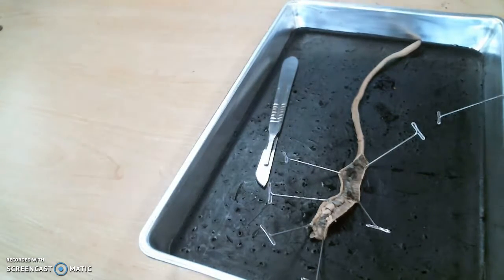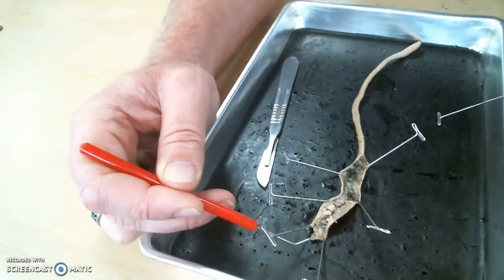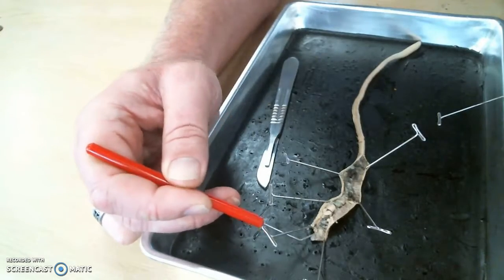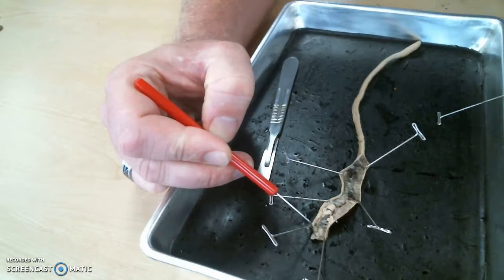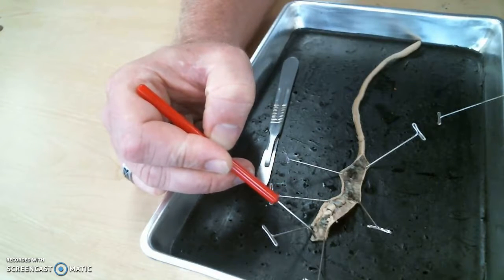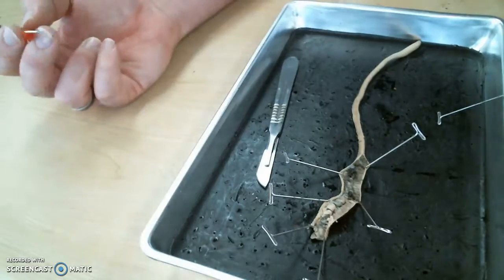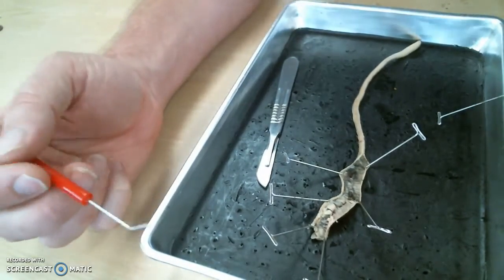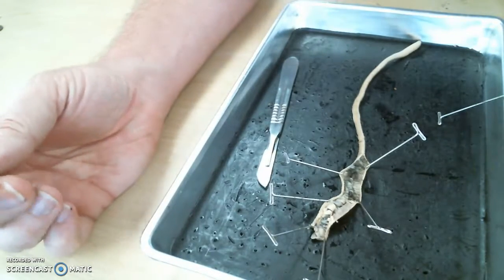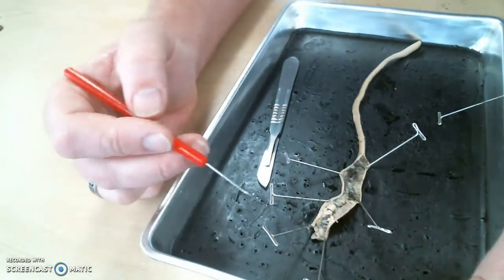That'll work. Okay. So, we already said the mouth was up here. And there's this beige organ right inside the mouth, and its job is to suck soil through the mouth. And what's that sucking organ called? No, that is not the ganglia. What's the pharynx? Good job. The pharynx is the structure right inside the mouth that sucks the soil into the worm.